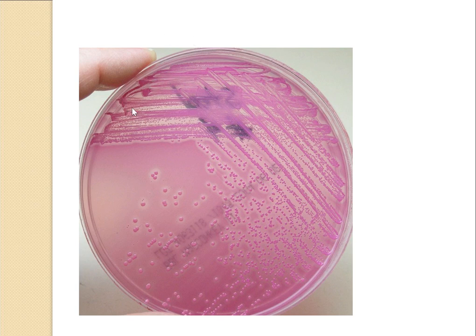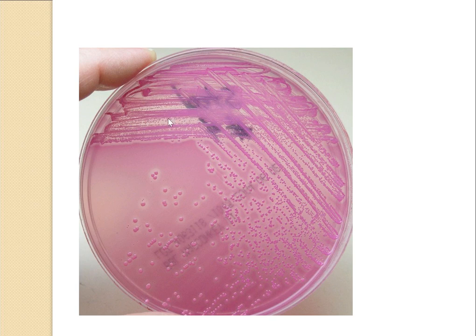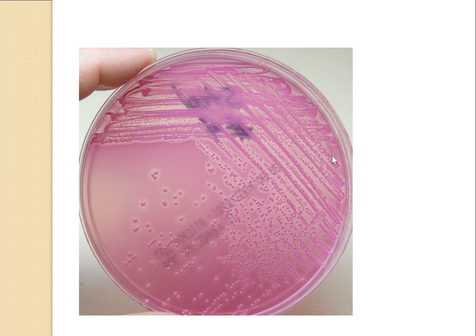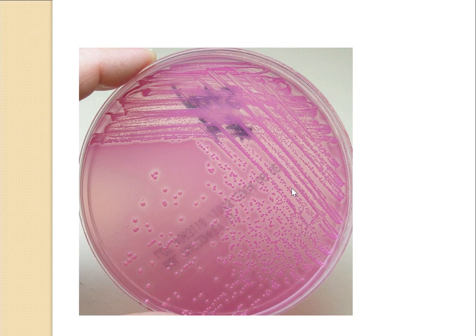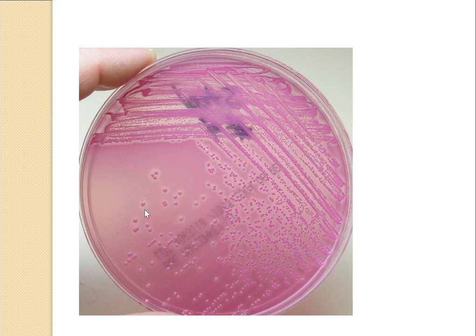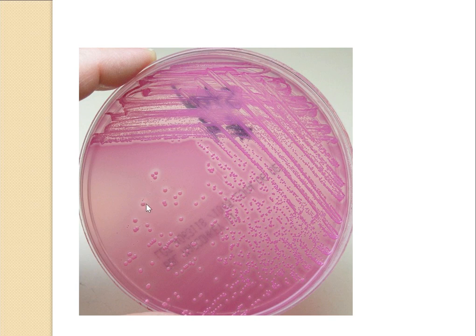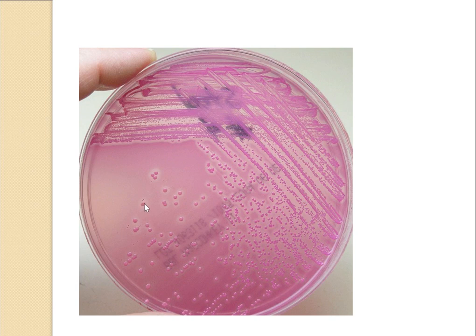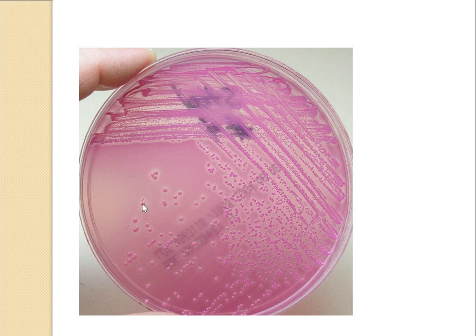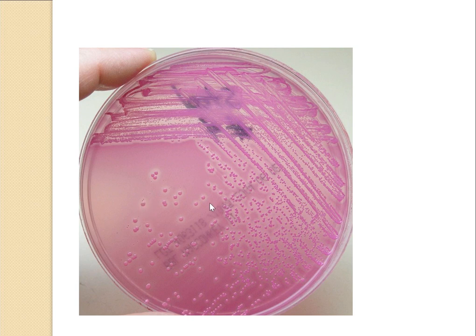In the first quadrant, a single colony cannot be identified because colonies are very crowded. In the second quadrant, colony numbers are lessened. In the third quadrant, there are fewer colonies than in the second. In the last quadrant, colonies can be easily isolated — a single colony can be picked with the nichrome wire loop, subcultured into another nutrient medium, and pure culture can be obtained from the mixed culture.